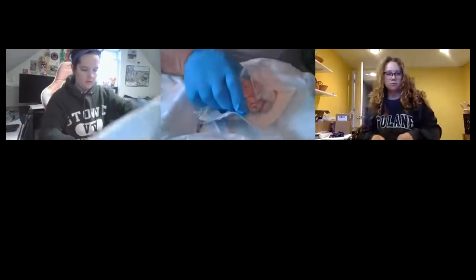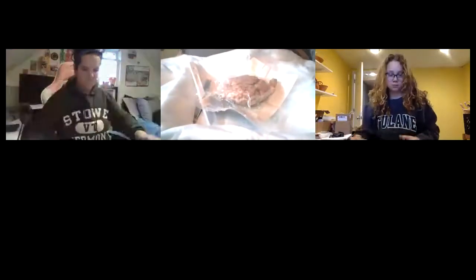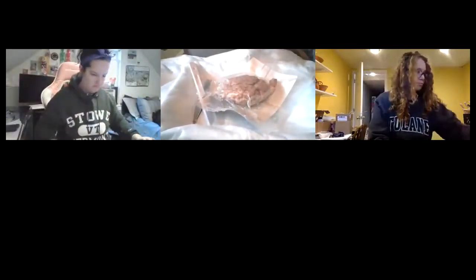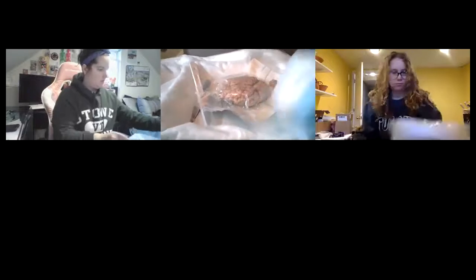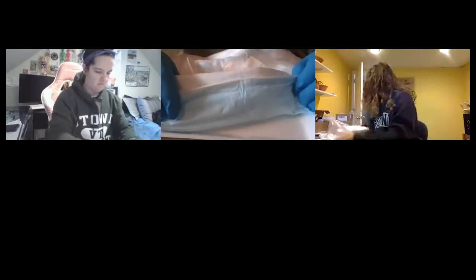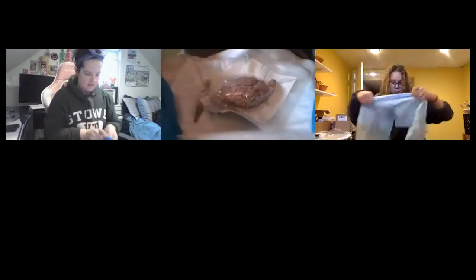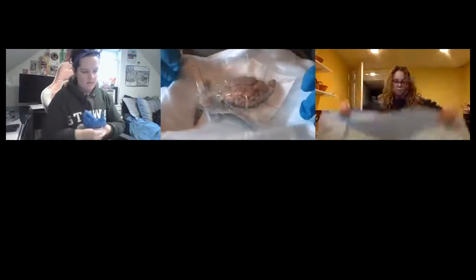Let me give you a little better view. I set this up with the apron on the bottom of my table, so I don't mess up the table. I put this sponge pad on top of the section, because this is just a styrofoam, something they give you in a butcher shop. I'm going to throw all this out after, except for the apron.